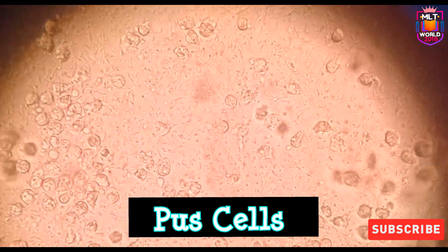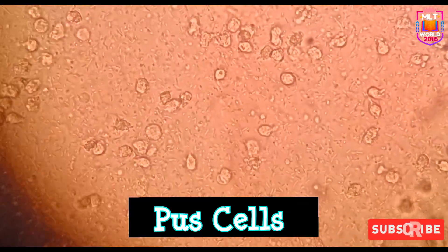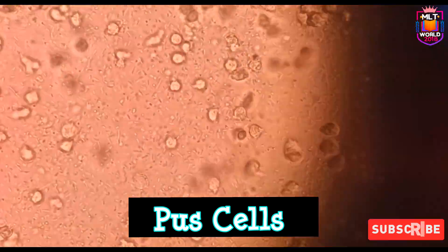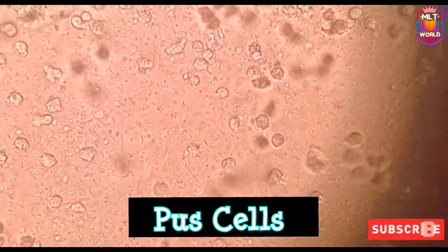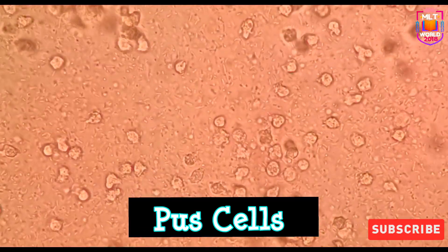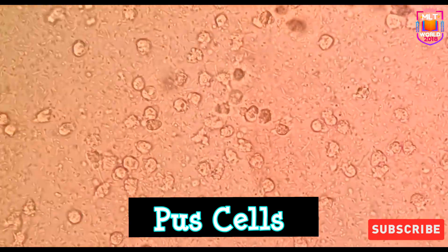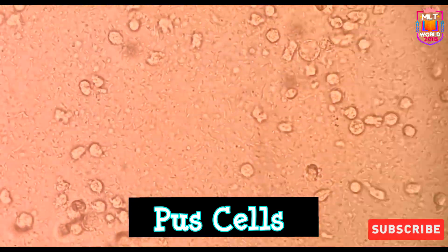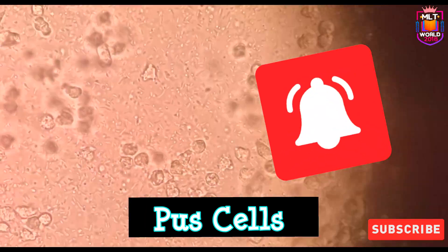So don't be confused — pus cells are always granulated. Now you see in this pus cells slide, the pus cells are a little bit smaller in size compared to the previous slide, but all pus cells are granulated. The small small dots are bacteria, and the other cells in this slide are 99% pus cells only.